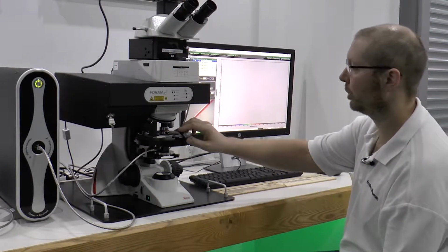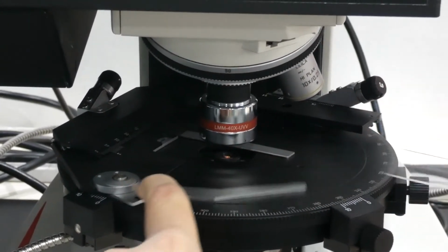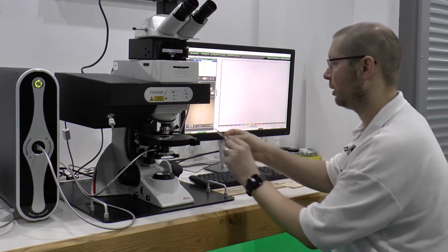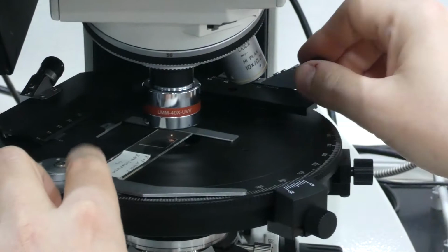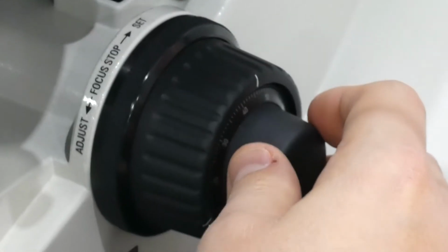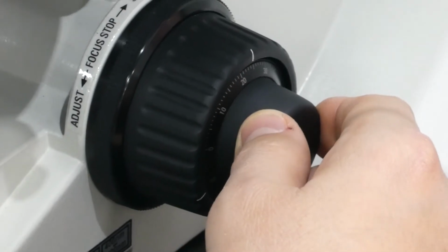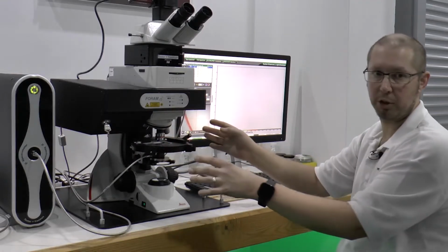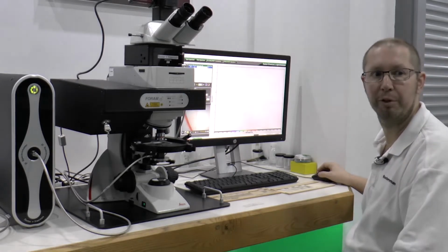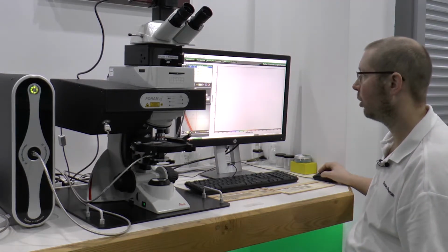Once we've recorded our repeat measurements for the control fibre, we're now going to place in our sample already prepared for the questioned fibres. So we just need to swap the samples over, and then we need to find those on the slide. There we go. Get that in focus. Because we've now swapped the sample over, we would now need to record the white and dark reference measurements again before we start taking our spectral measurements of this fibre.